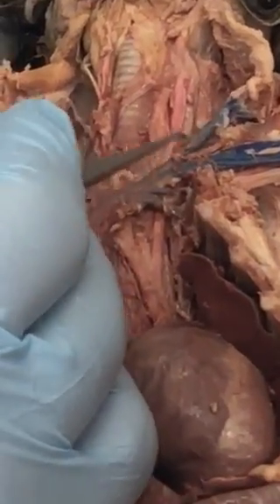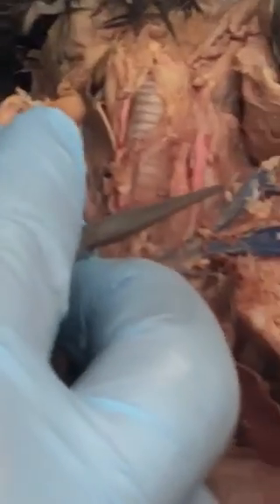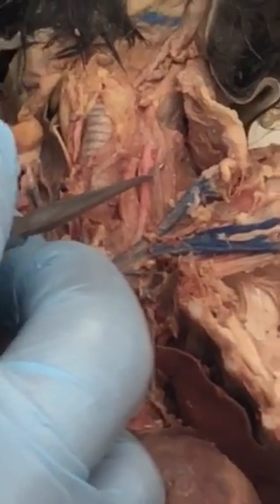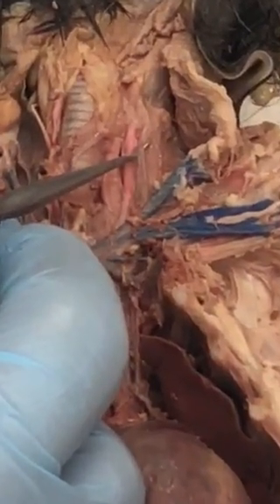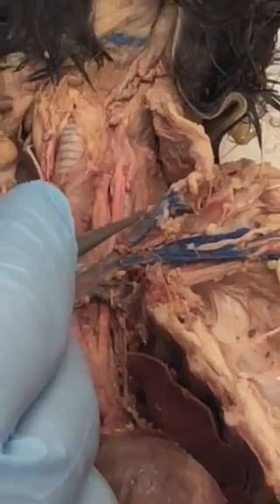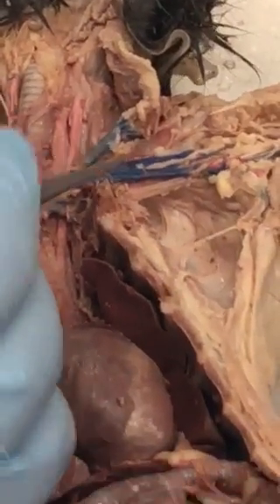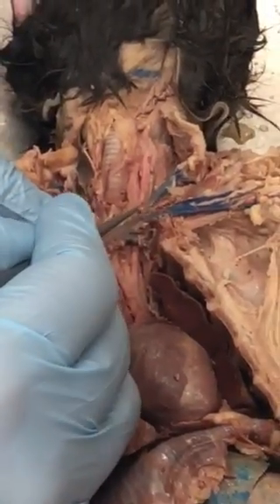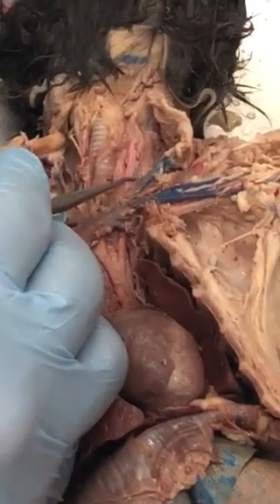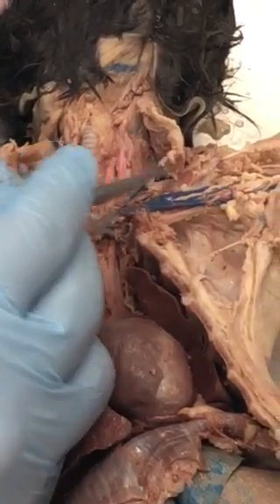You see this little tiny one right there? That is the internal jugular vein. Then this is the external jugular vein. So we have this little section here: jugular, then internal and then external jugular.